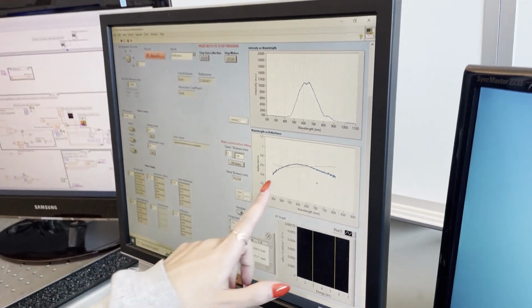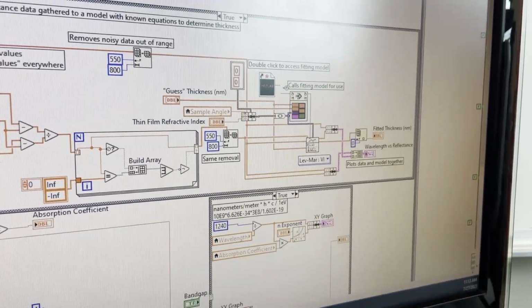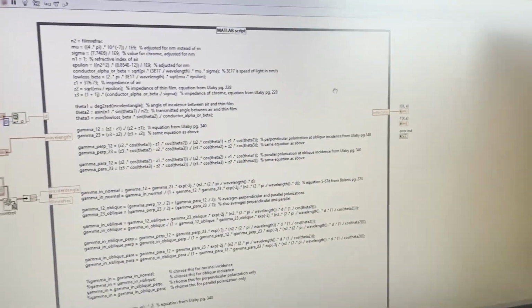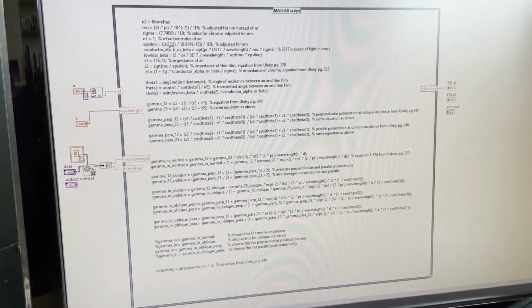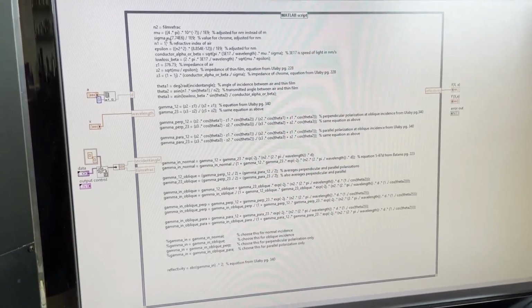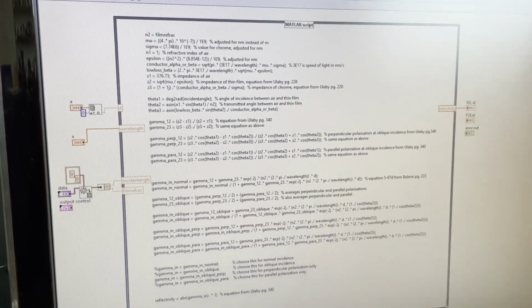Now, this fitting works in the nonlinear fit section of the VI, and it calls this other VI, which is a MATLAB script. Now, if you want to change the fitting function, you're going to have to change this MATLAB script. Right now it's hard-coded to only work for Chrome. You can see the sigma value is just for Chrome. If you're going to want to change it to another material, you're going to need to change this script in order to make it fit on the other VI.